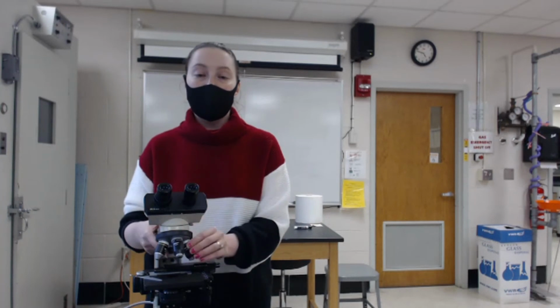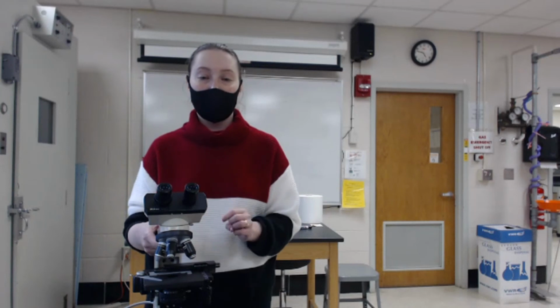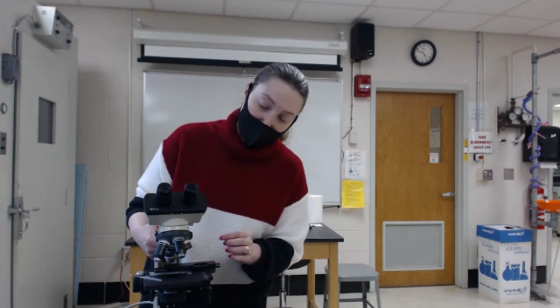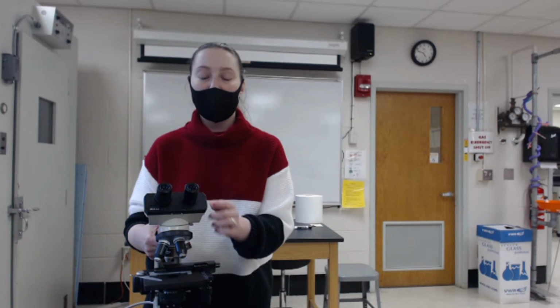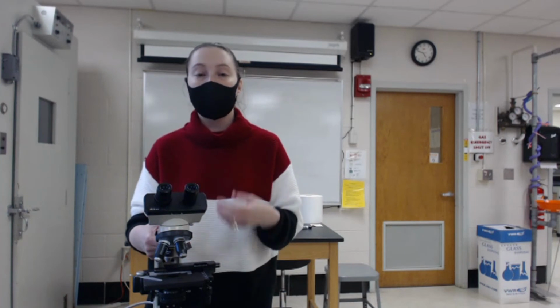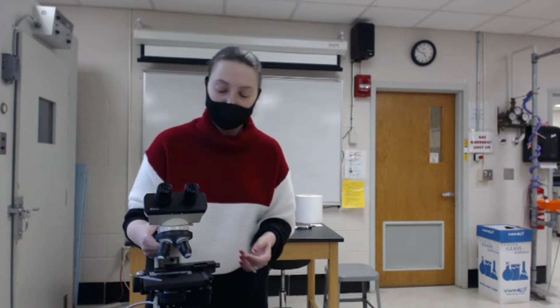These lenses are specifically designed to work with air as a medium. However, in microbiology, we're primarily going to use the oil immersion lens to magnify our samples. The oil immersion lens is 100 times magnification. So if we look at the total magnification, which includes the objective oil immersion lens and the ocular lens, there will be a total of 1,000 times magnification. That will make it easier for us to see the bacteria, which are so tiny and small.